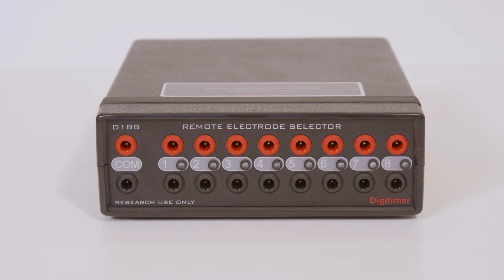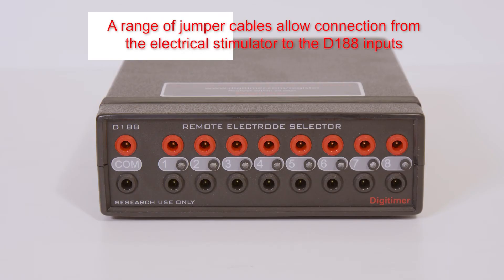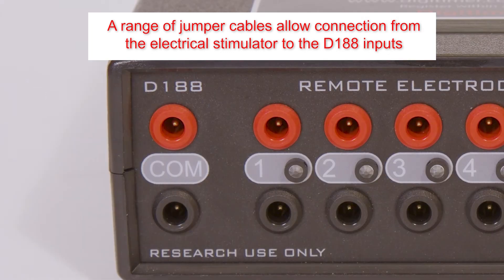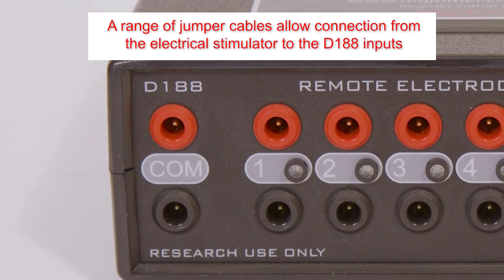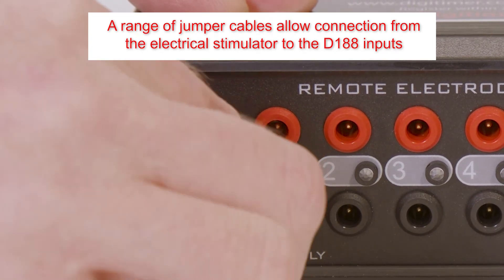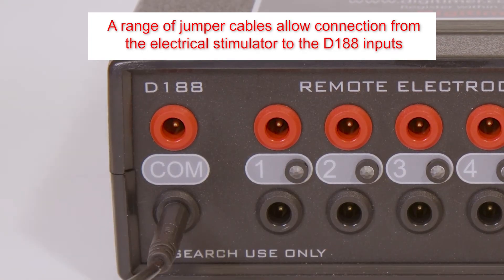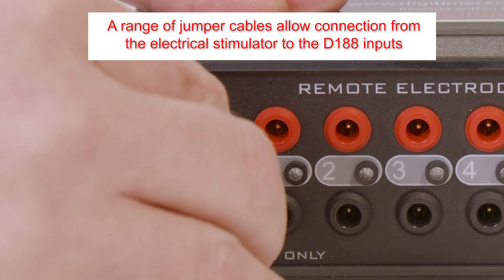The stimulus source for the D188 should be connected via the pair of input sockets labelled COM on the far left of the front panel. Digitimer supplies a range of jumper cables to connect between stimulators and the D188.